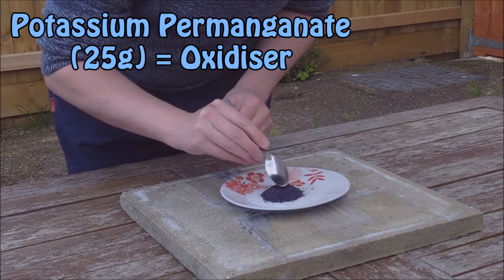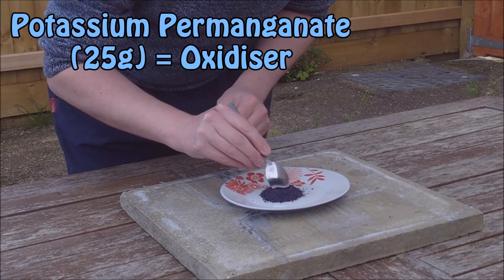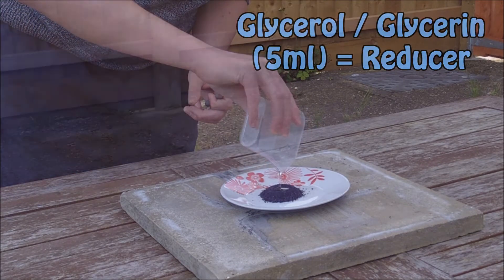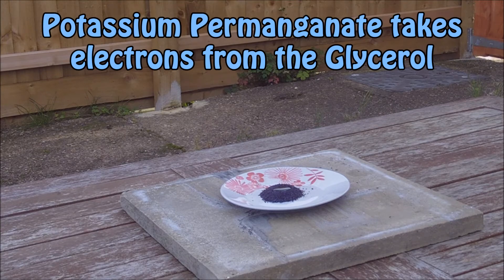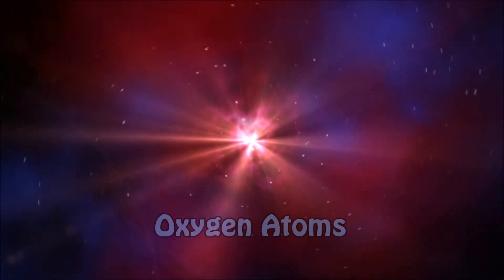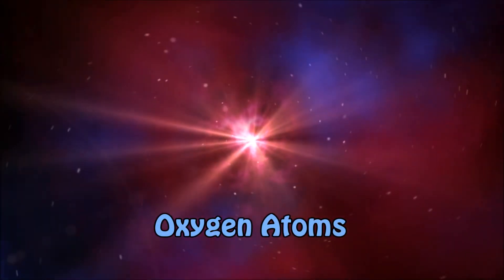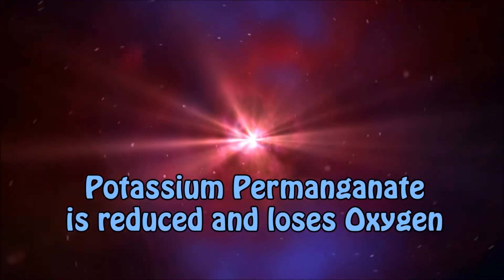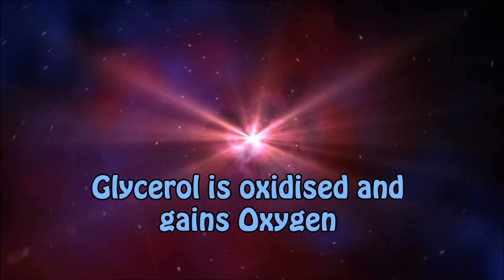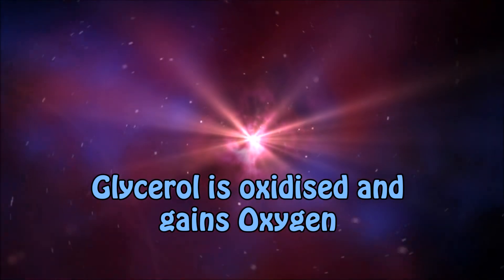The potassium permanganate is the oxidizer and the glycerol is the reducer. The potassium permanganate takes electrons from the glycerol, and this is usually in the form of oxygen atoms. So the potassium permanganate is reduced and ends up losing oxygen, and the glycerol is therefore oxidized and gains oxygen.